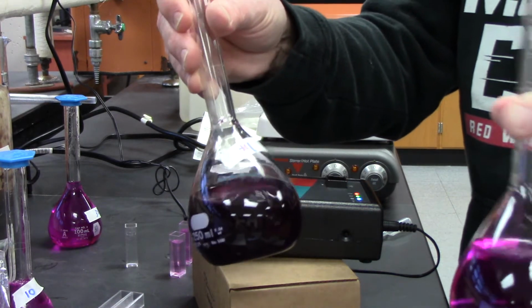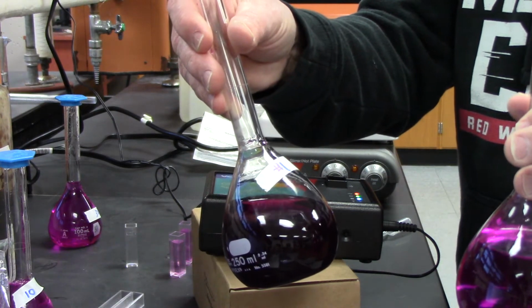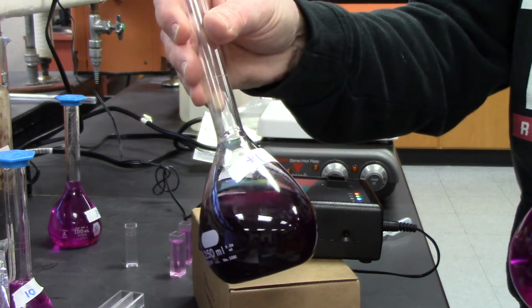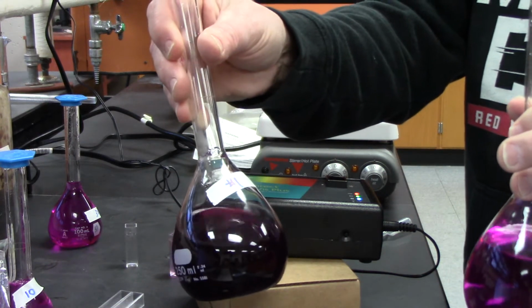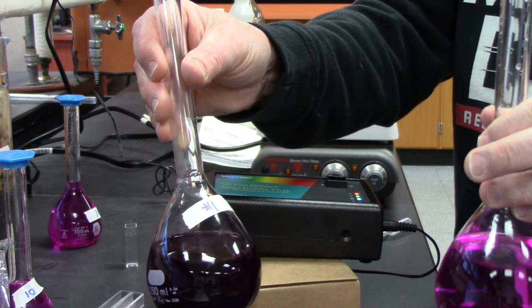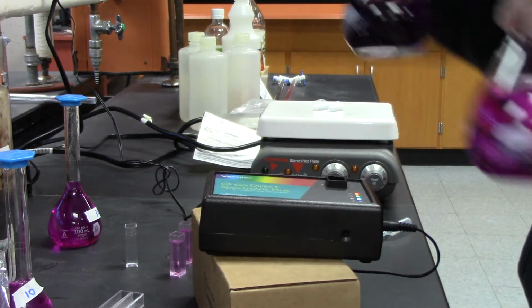Now, what we want to do is you can just tell that number one is more concentrated than number two, and so this should have, at the same wavelength 545, a higher density or absorbance, we call that, than this guy. Okay, and we can do that.